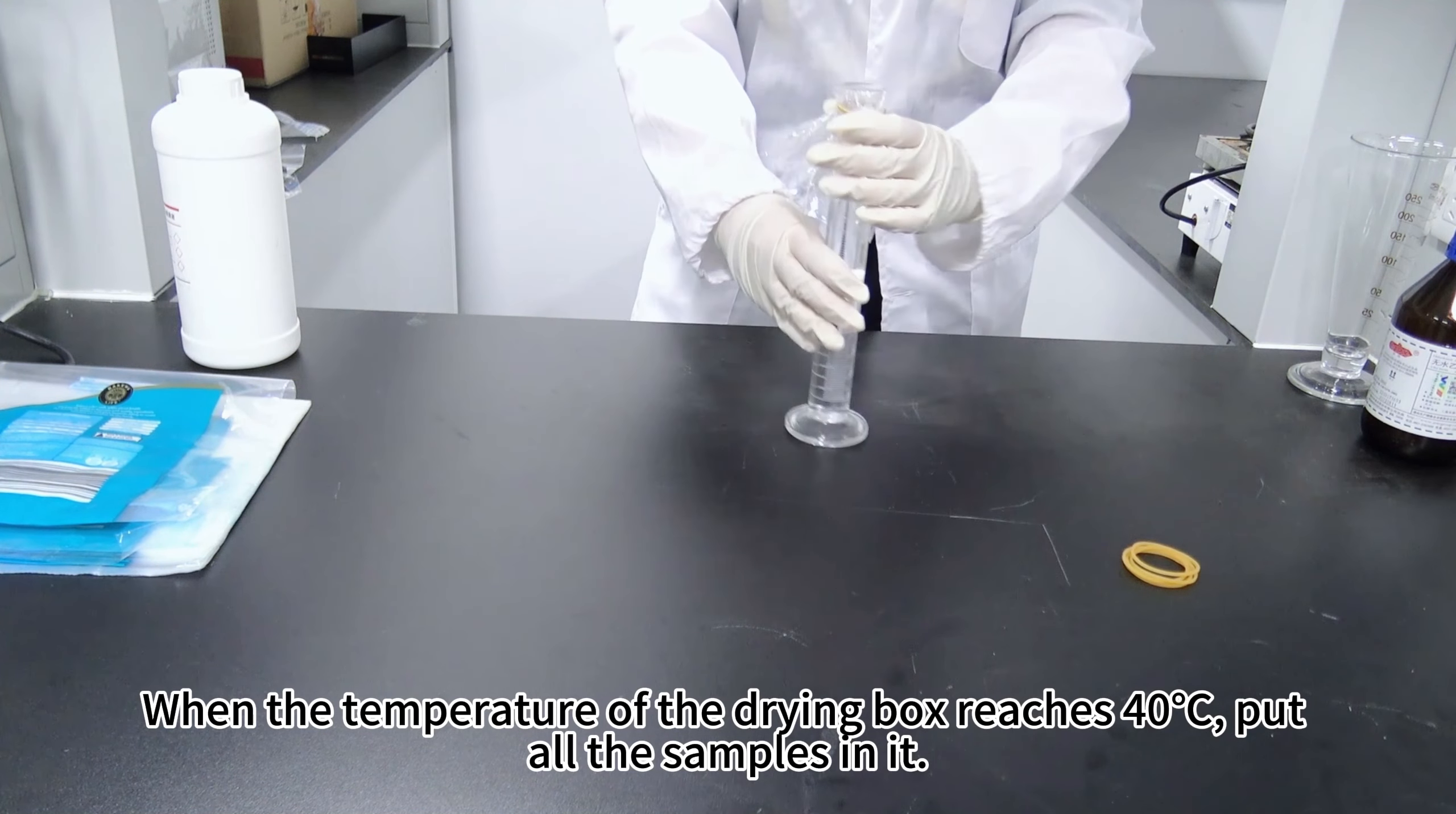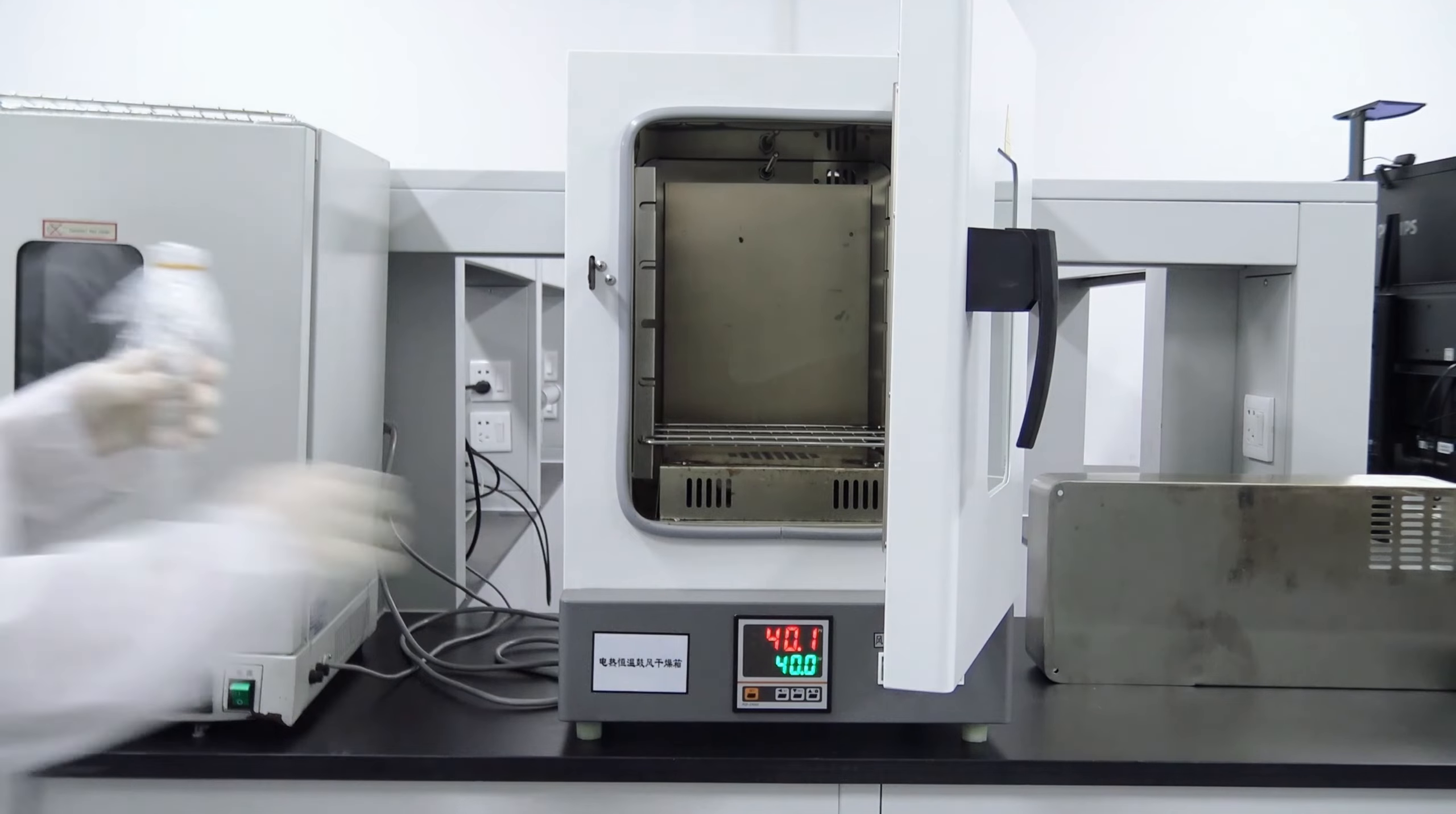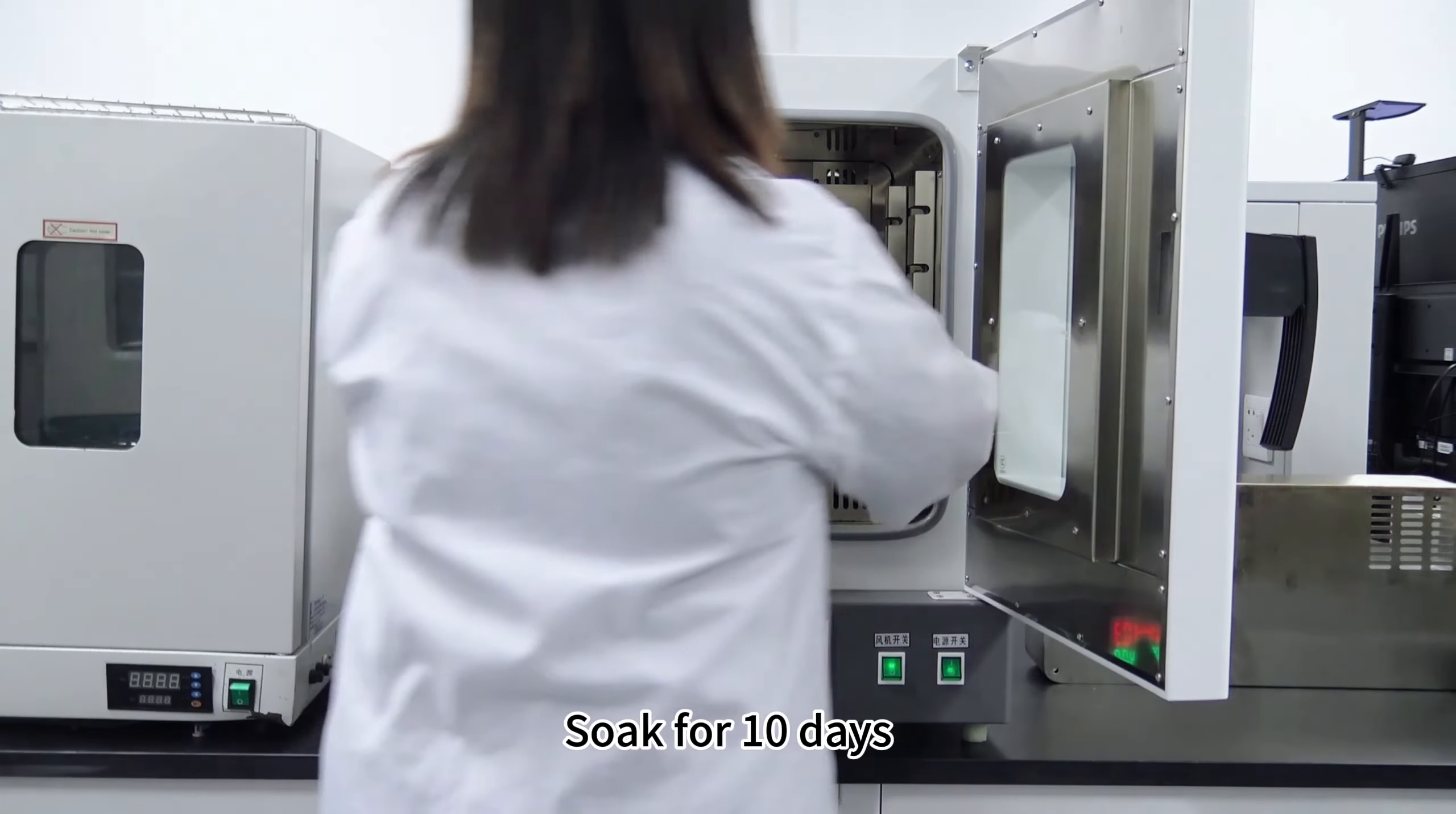When the temperature of the drying box reaches 40 degrees Celsius, put all the samples in it. Soak for 10 days.